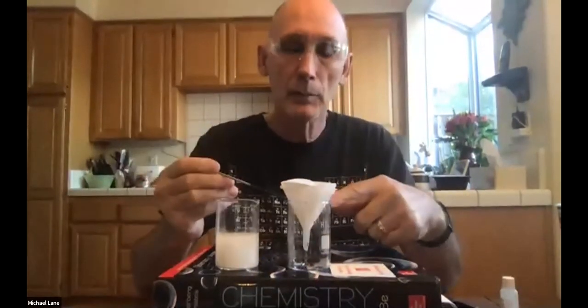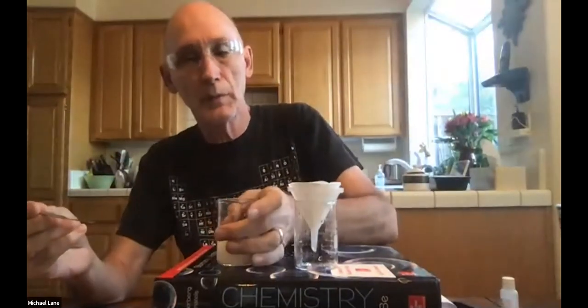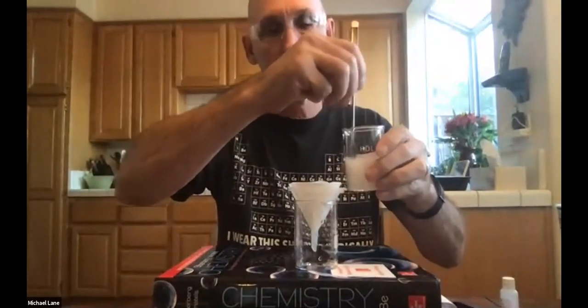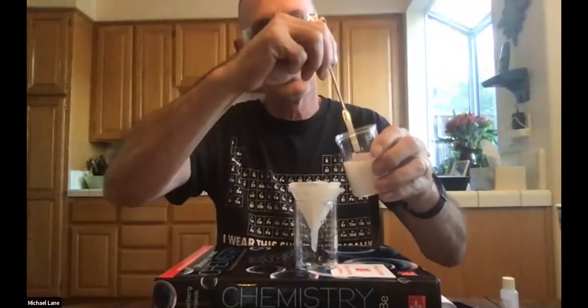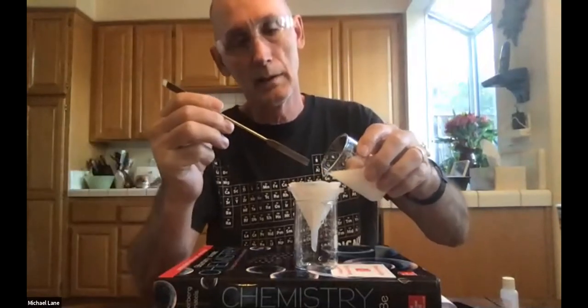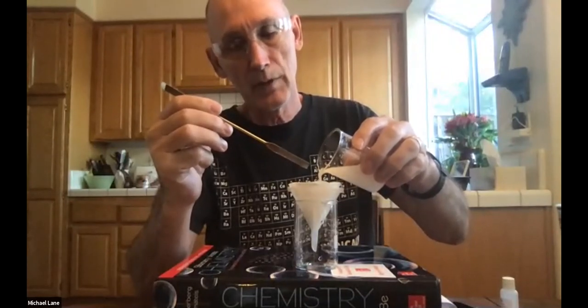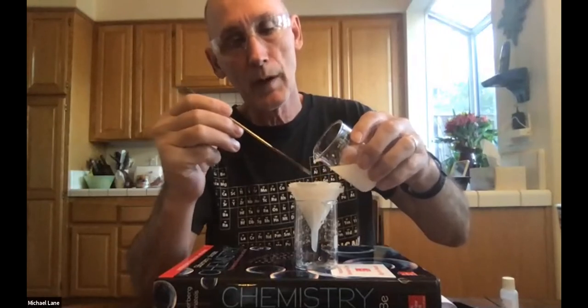Be careful not to pour so much. Don't pour it all at the same time. It'll overfill, and of course, that will immediately ruin any possibility of getting good results. So, that's stirred and suspended, and pour it in there. And again, what you can't see is how high I'm going, but I'm going about 2/3 of the way up. So there we go.